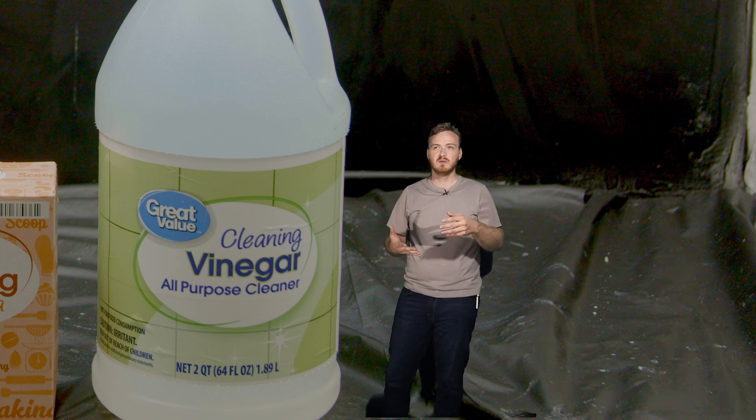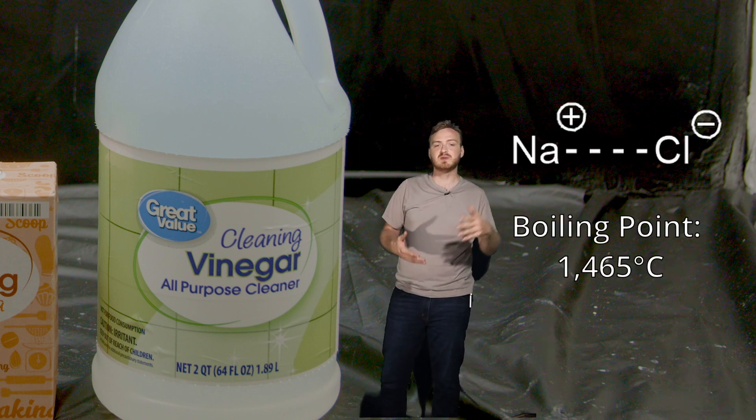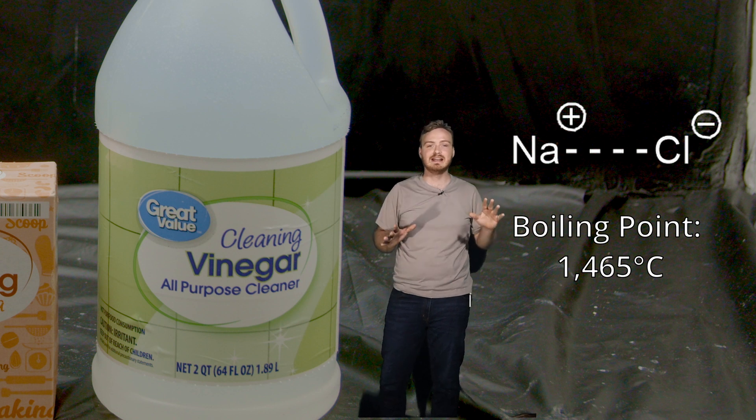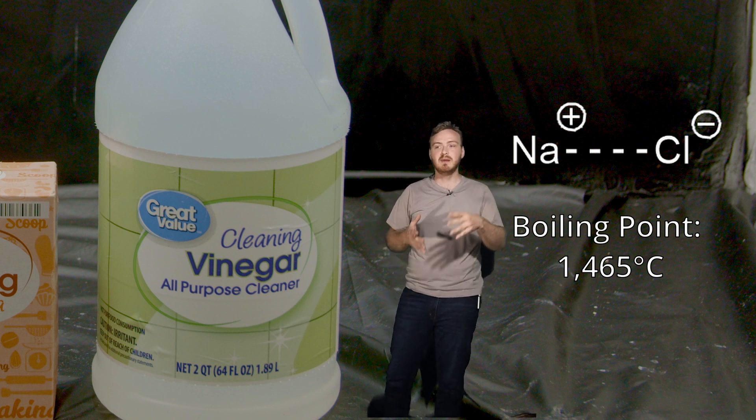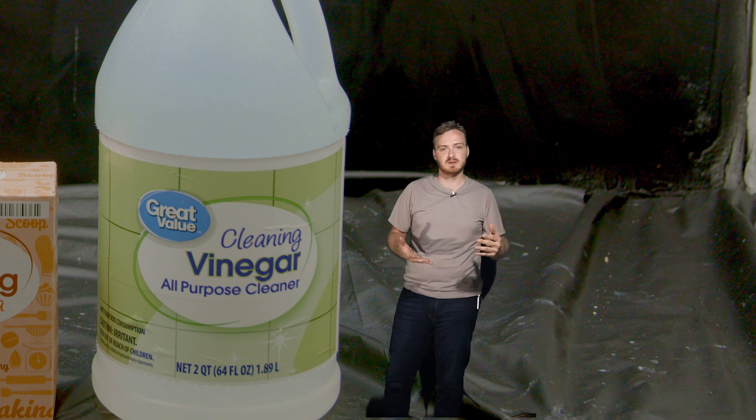But what about salt? Salt has a really high boiling point, insanely high. So what if we could make the acetic acid into a salt of some sort?